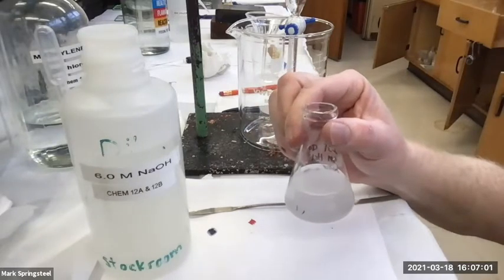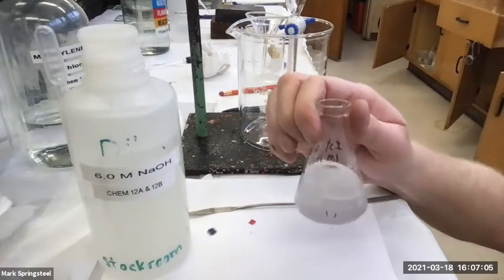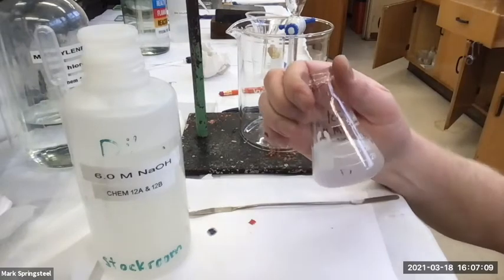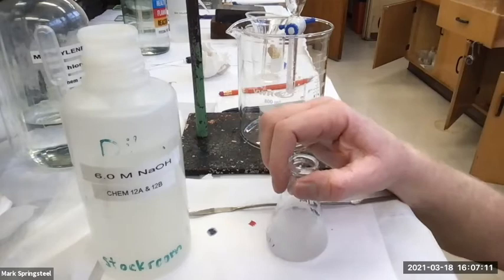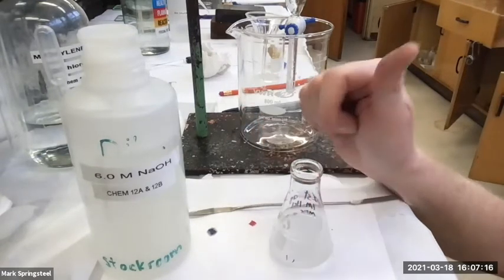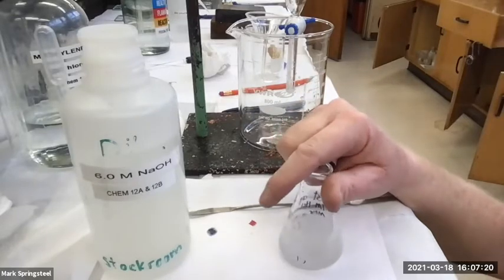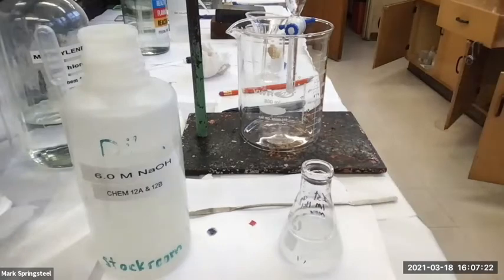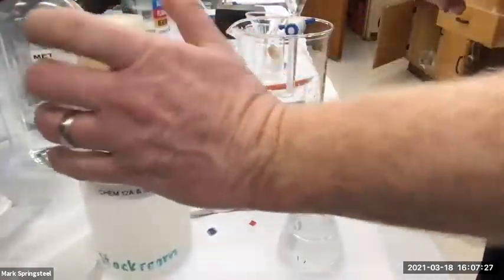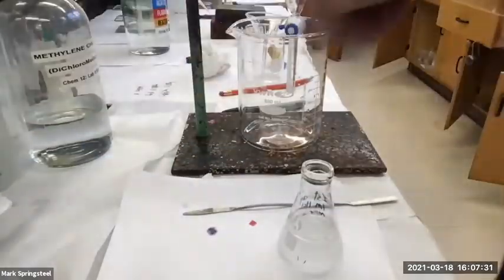This one is a tricky one. I have a lot of students get caught up on this because it sort of looks like a fine precipitate, but I know it's actually not. I think I need to stop using the benzocaine. I like benzocaine, but it doesn't precipitate out that well. And so when you get something like this where it's not a precipitate, it sort of looks like last time's benzoate. Huh? Yeah. So I'm going to put this down as not a precipitate, and I'm going to proceed as if it isn't, and then we're going to see if we check for an acid.